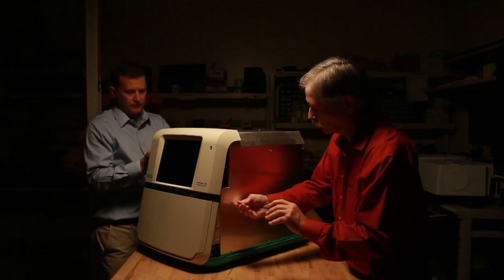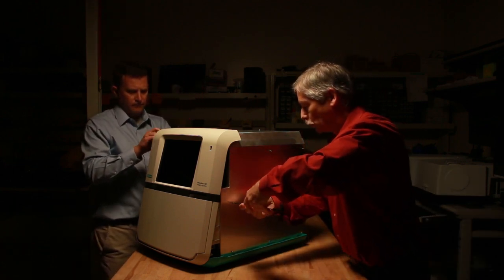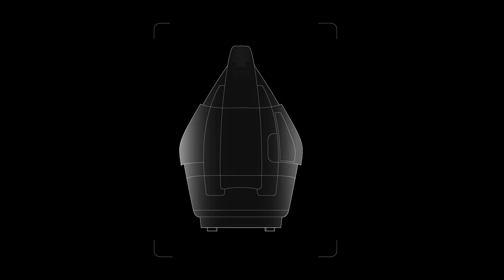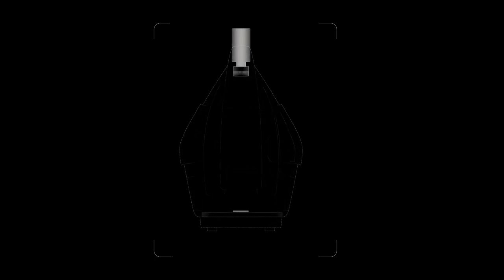Resolution is more important when you're looking at a complicated sample or something which is made of many bands. Our legacy instrumentation was wanting in a few spaces, which caused us to have to go to a completely new platform and completely new camera in order to fulfill all these needs.